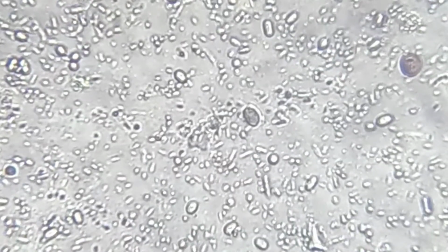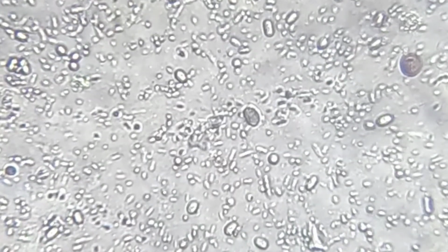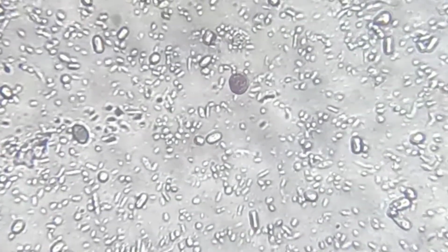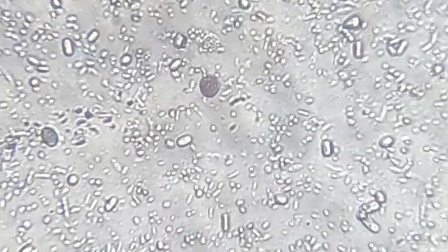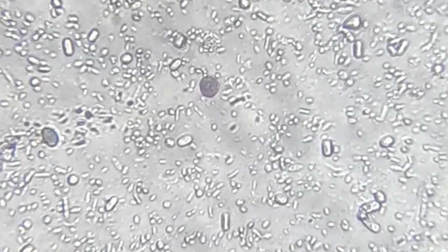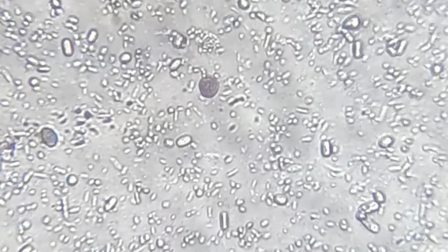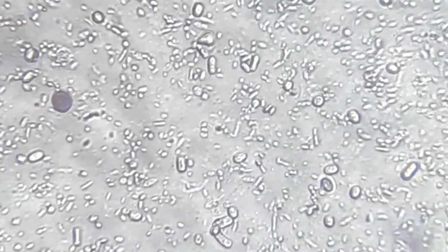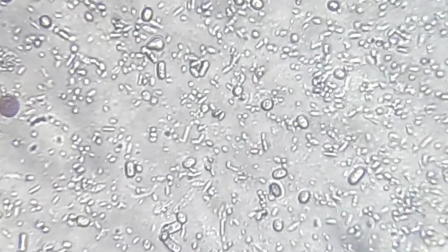You can also notice that some of these tiny organisms shake or move slightly. Many times this is Brownian motion, movement caused by water molecules pushing against them, not because they have legs or muscles. Real swimming movement usually appears as fast, straight or wavy motion.